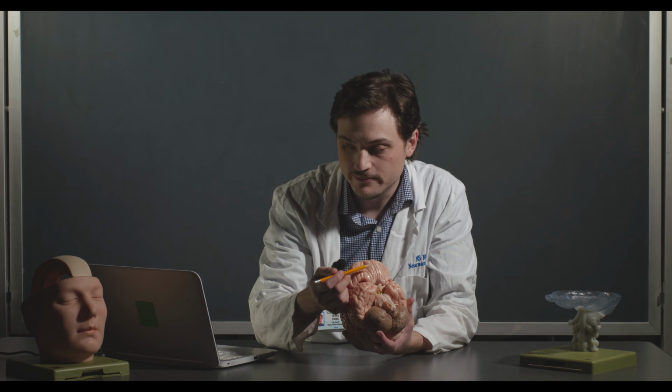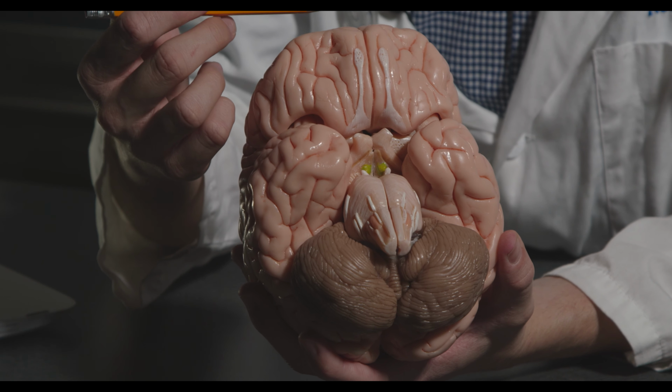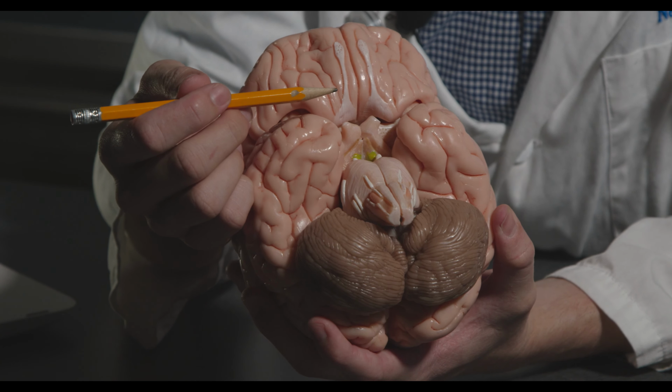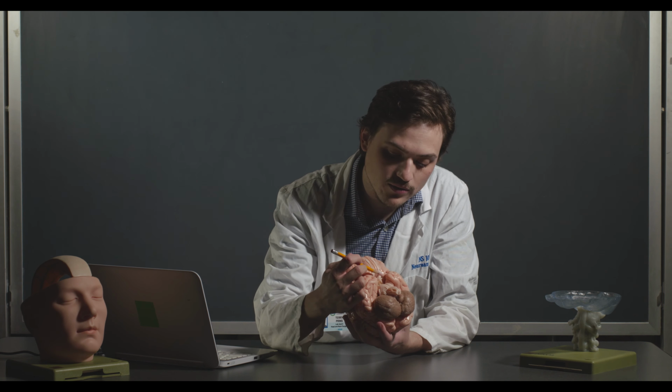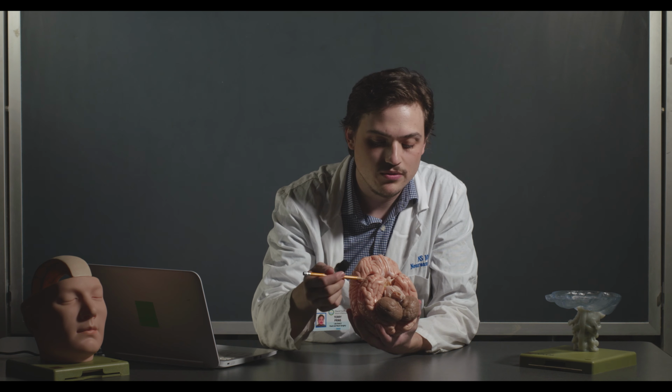One of the cranial nerves, cranial nerve 1, actually comes out of the olfactory bulbs, which we'll talk about in the cranial nerve lecture. Here you can see the longitudinal fissure, which is just that giant groove that separates the human brain into the two hemispheres. And then we can see the optic chiasm. Chiasm gets its name from chi, the Greek letter that is just an X, because it's essentially where optic fibers cross over to the other hemisphere.